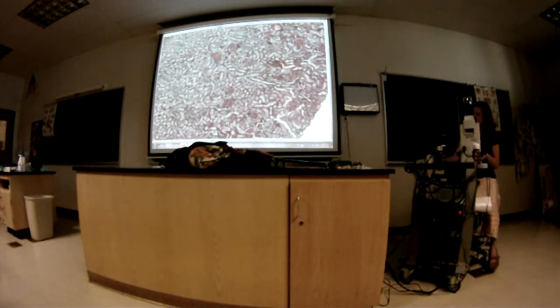This one I like because the corpuscles really show up really well.